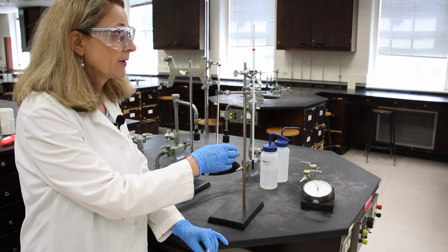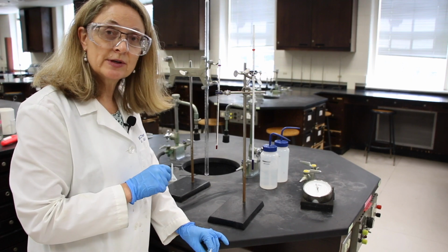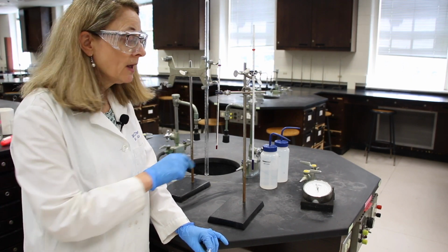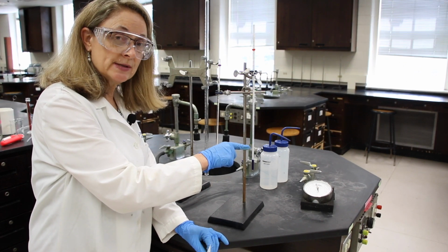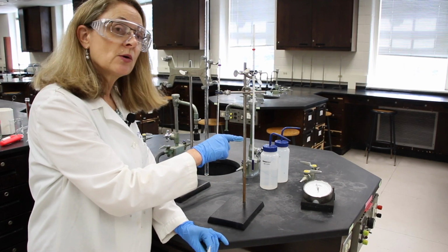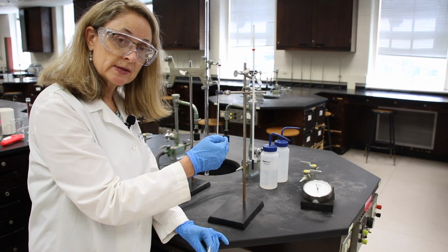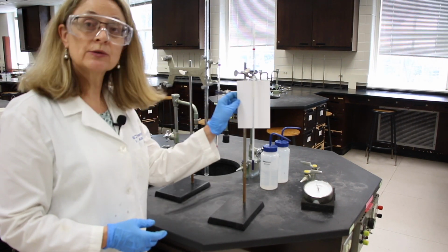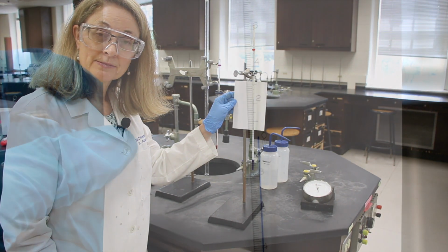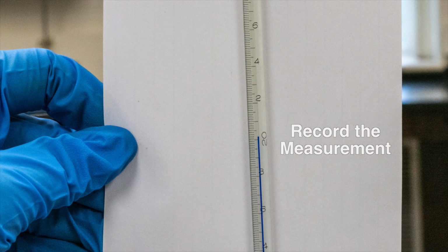The other thermometer is the 0 to 50 degrees Celsius thermometer. The smallest markings here are in the 0.1 degrees Celsius. So we'll read to the 0.1 degrees Celsius and estimate to the 100th. I'd like you to read this thermometer. I'd like you to answer the next 4 questions, paying attention to the significant figure help in parentheses.